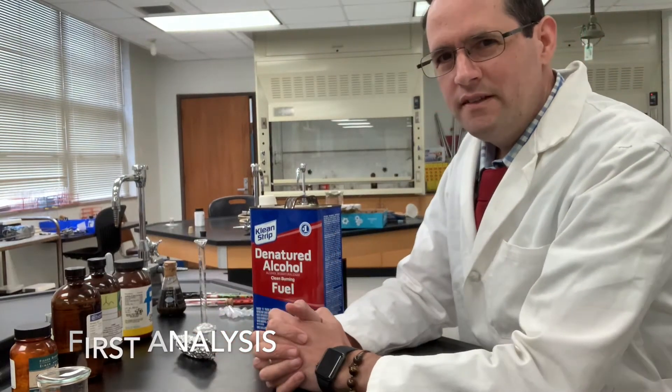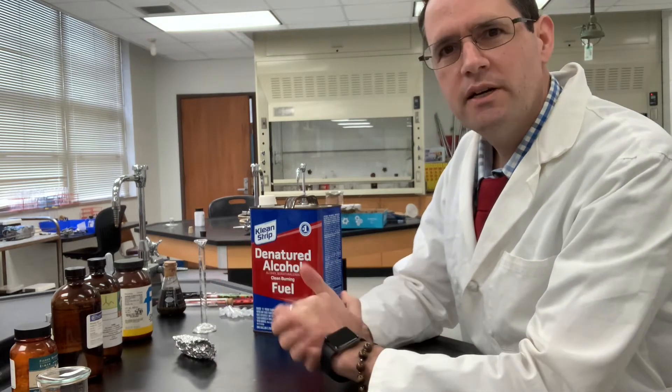All right, now that you've read the textbook chapter on TLC and watched my introduction, we're going to go ahead and do the lab now.